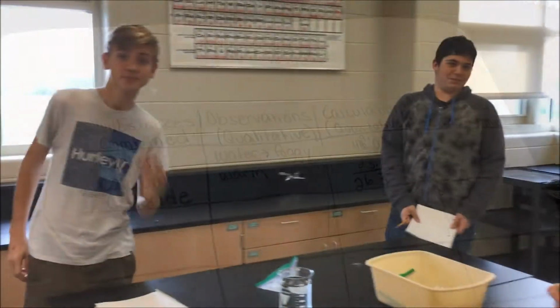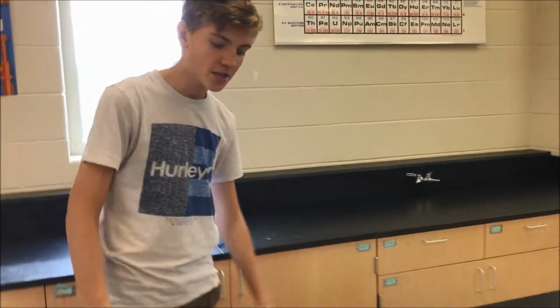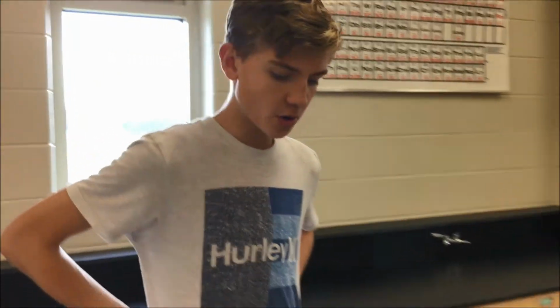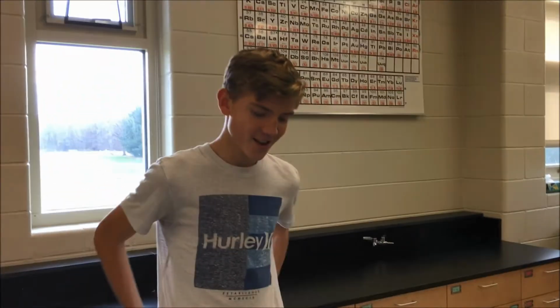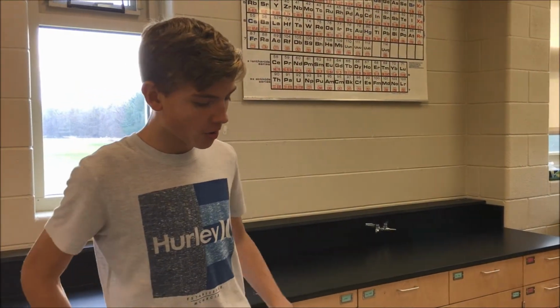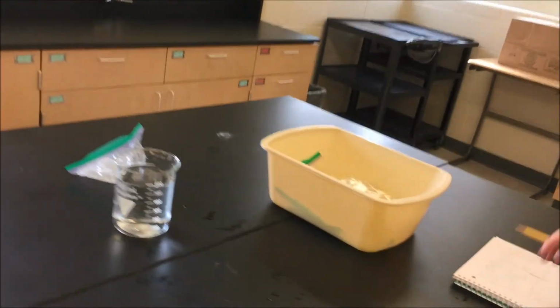So now we're with the next group here who tested baking soda. What did you guys figure out? Okay, so when we mixed baking soda and water, we found that the water turned cold and white, and the temperature of the water was 20.7 degrees Celsius. And we said that that is an endothermic reaction because it is pulling the energy out of the air around it. Okay, cool.